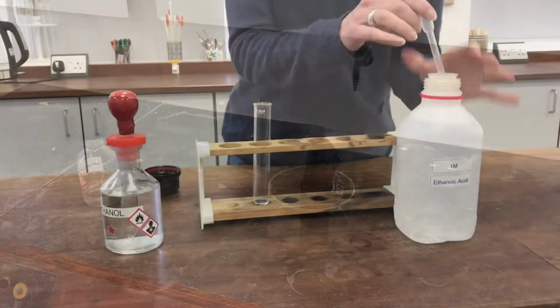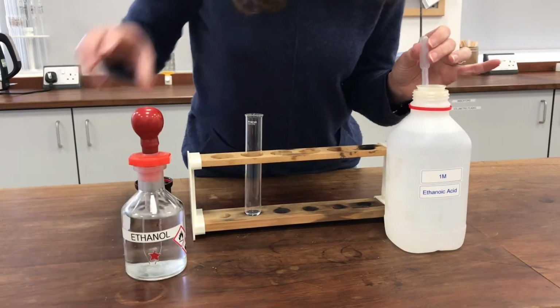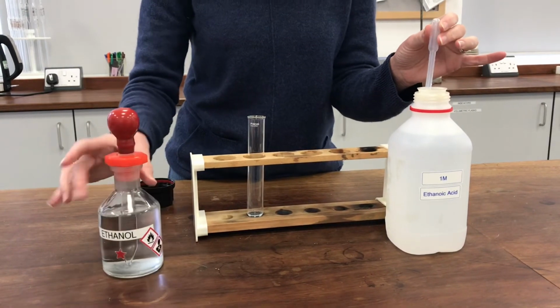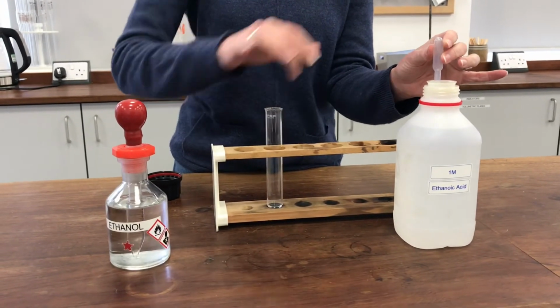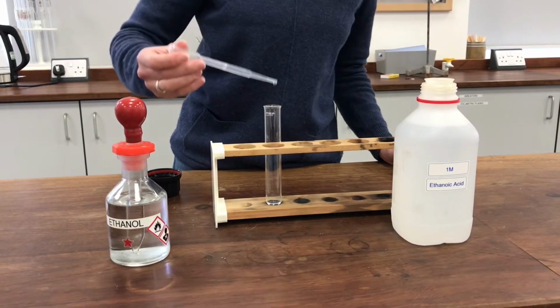This reaction, I'm going to have a go at making an ester. So I'm going to use ethanol and ethanoic acid. So I wonder if you can think which ester I will be able to make from those. Now, I've already put a little bit of concentrated sulfuric acid in the bottom of my boiling tube. I'm about to add my 2 reagents, my ethanoic acid and my ethanol, to it.